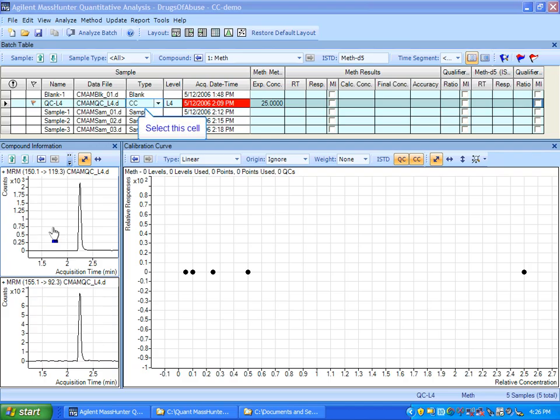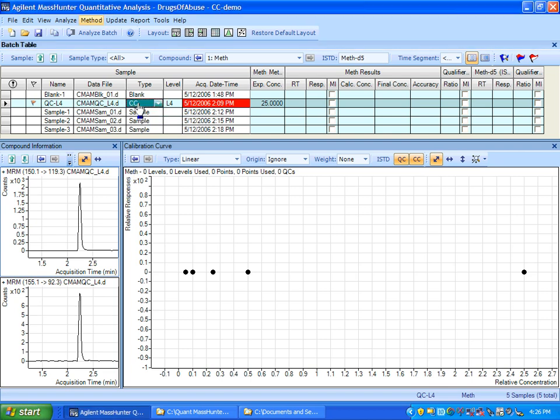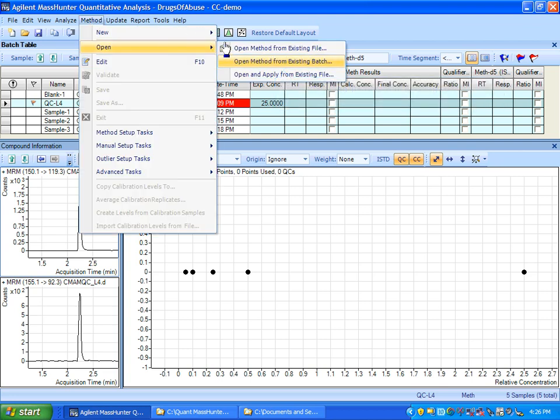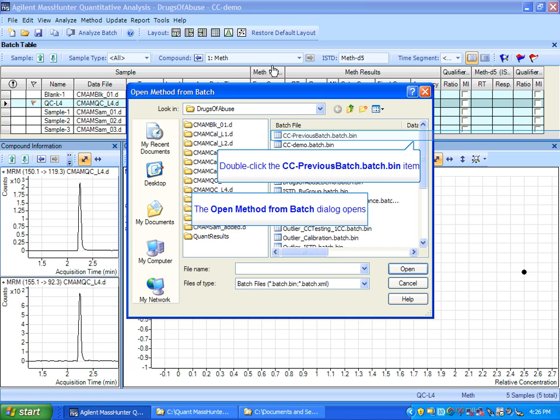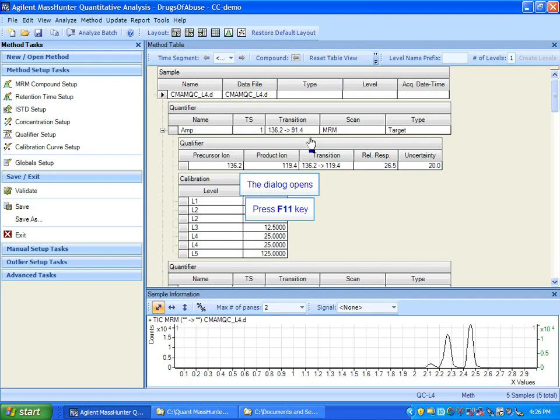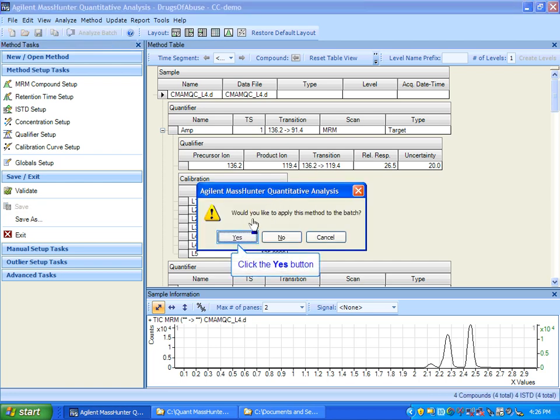All right, here I am in Batch at a Glance looking at a couple three samples and my CC. What I'm going to do here is get a previous calibration curve from a method from a previous batch. And the easiest way to do that is to go to Method and then open a method from an existing batch. So when I do that, there's a previous batch here, and now I've fetched that method and I've gone over to the method editor, and I'm going to apply that method.